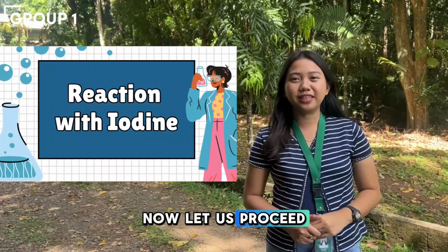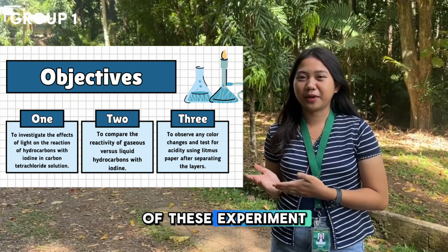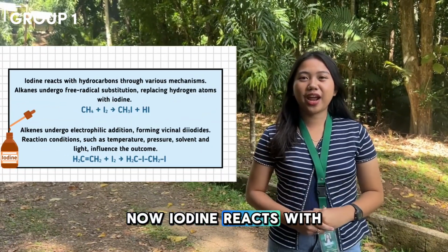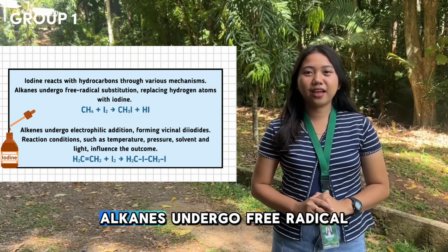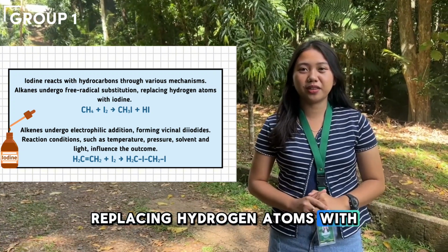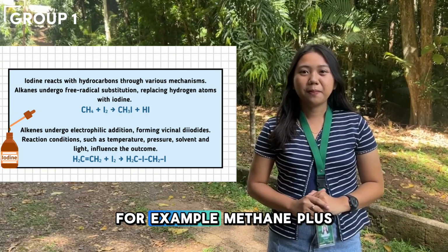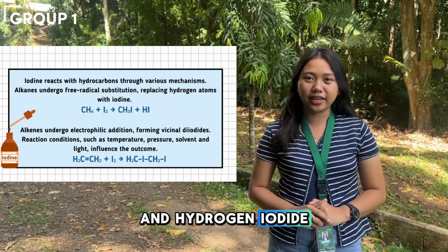Now, let us proceed with the reaction of iodine. These are the objectives of this experiment. Iodine reacts with hydrocarbons through various mechanisms. Alkanes undergo free radical substitution, replacing hydrogen with iodine. For example, methane plus iodine yields methyl iodide and hydrogen iodide.